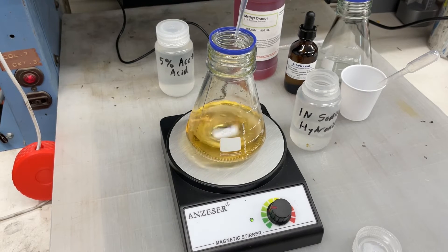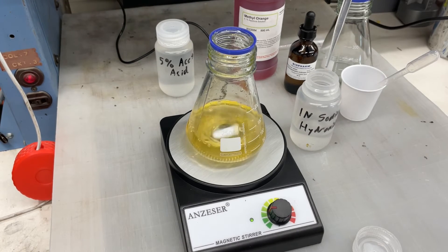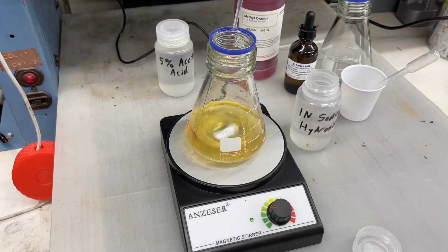In the book Aluminum How-To, he suggests between 5 and 20 grams per liter as the lower and upper limits for dissolved aluminum, but between 8 and 12 is good for color consistency. This one's much easier to do because you can see it change to bright pink, and whenever it changes to bright pink, that means that we are done.